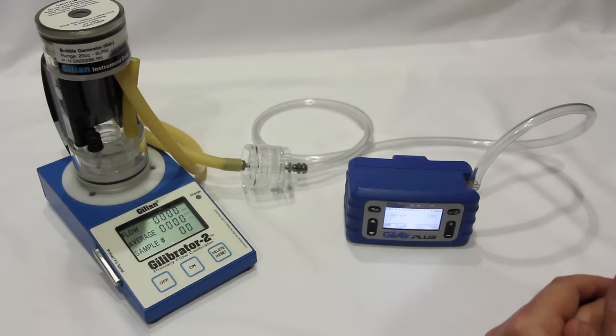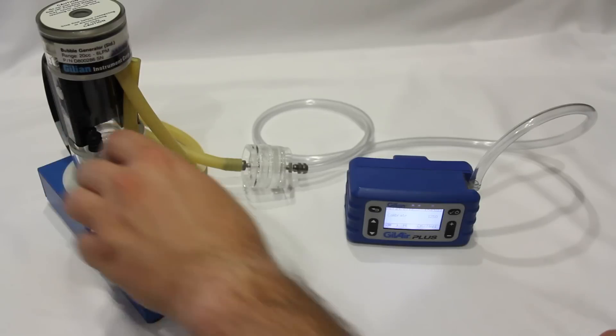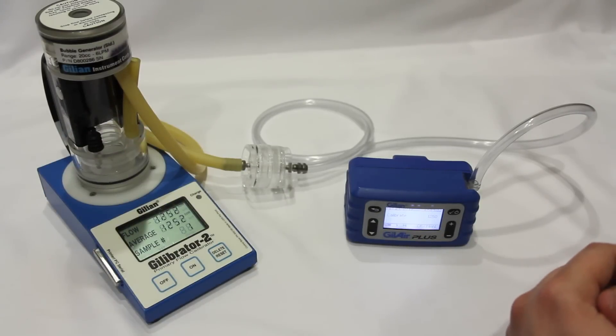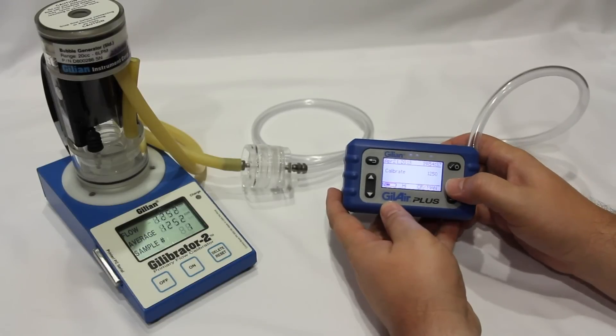Adjust the flow on the pump to match the calibrator. This should be accurate within 5% of the flow rate.